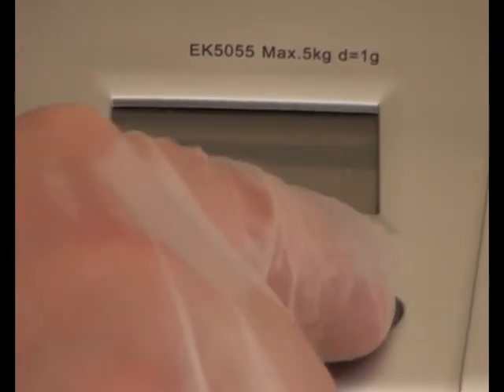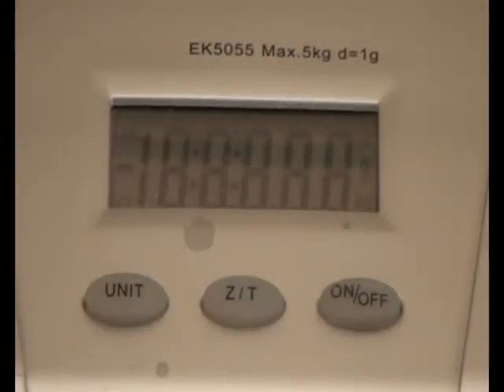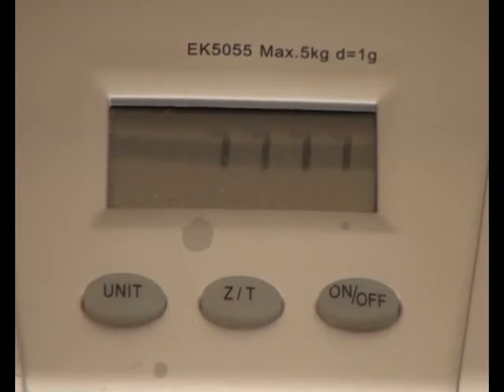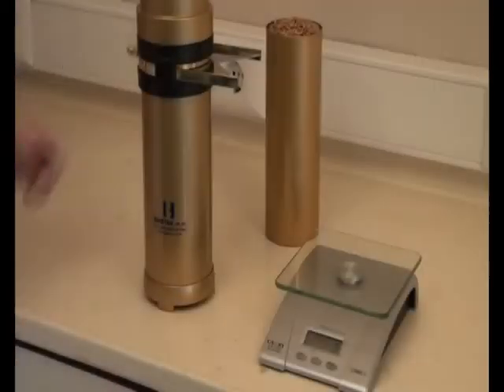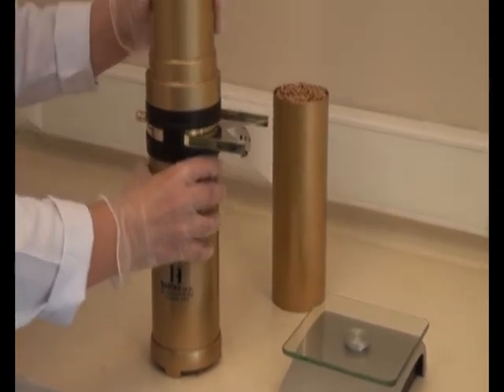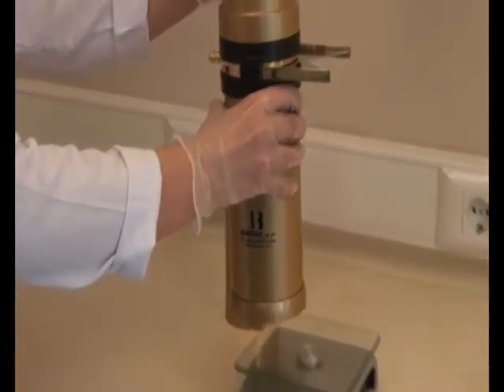Then the digital balance is turned on. The empty Hectaliter is weighed and it is noted.